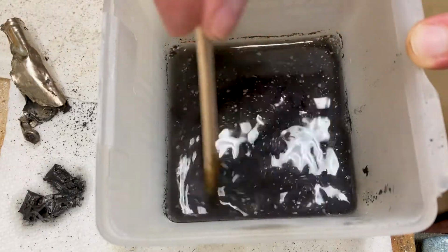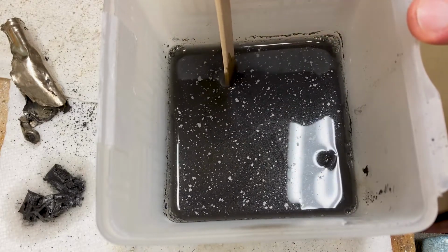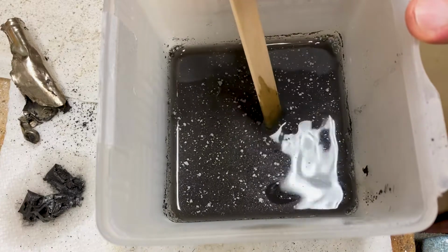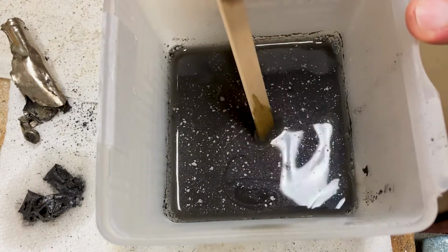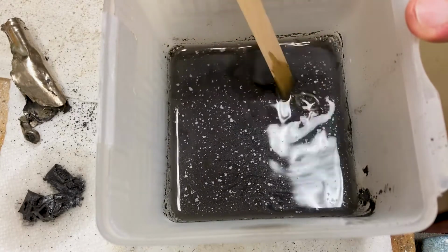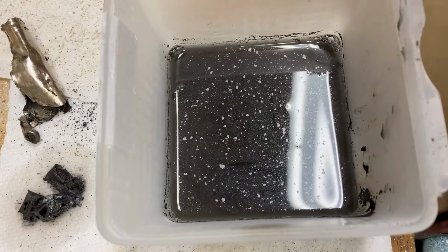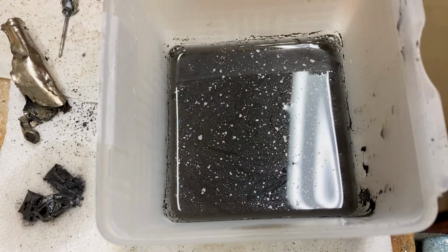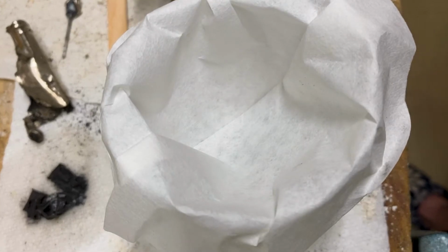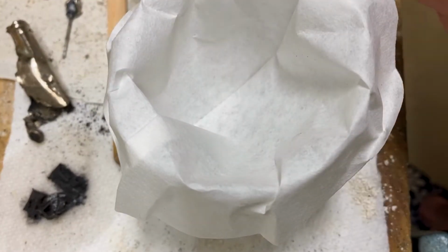There's going to be a little bit of an irony to this because theoretically, if this is a fully depleted battery, then it should be all zinc oxide. I'm going to change that zinc oxide into zinc citrate, with the ultimate goal of actually turning it back into zinc oxide. But the logic behind it is, again, it makes it easier for me to separate. And the other thing that it does is it makes it easier for me to be able to put that down as a thin film, which is what I'm going to be aiming for with this. Nothing says high quality chemistry better than a coffee filter and a plastic cup, but it'll do the job.